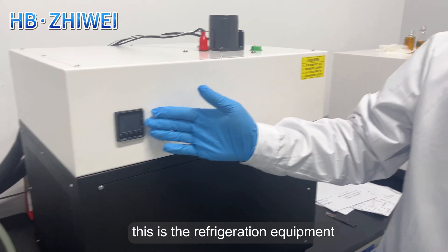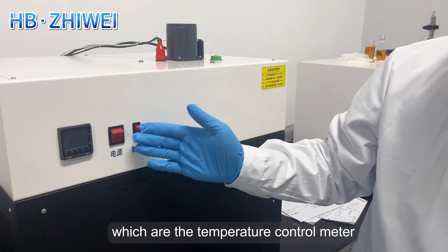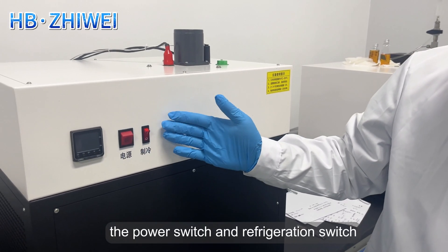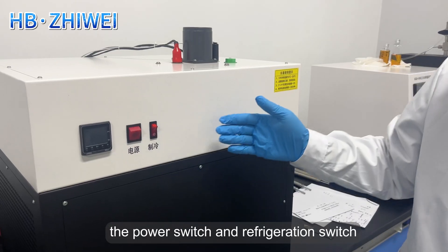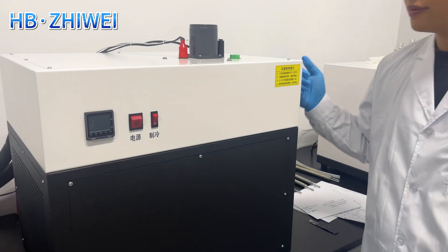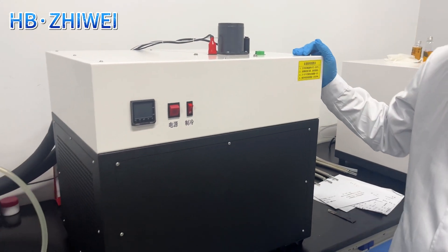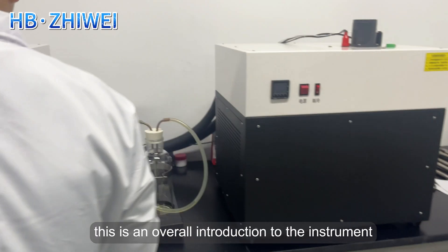This is the refrigeration equipment, which features the temperature control meter, the power switch, and the refrigeration switch. This is an overall introduction to the instrument.